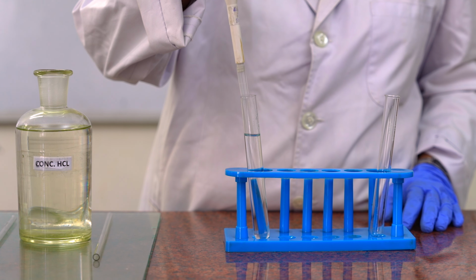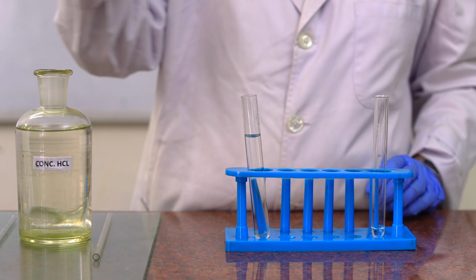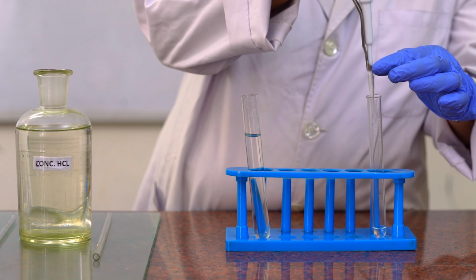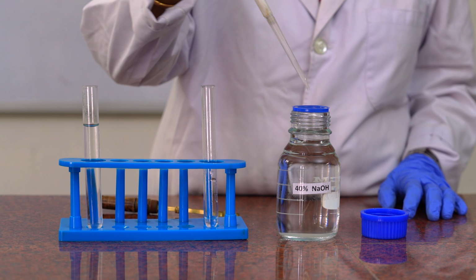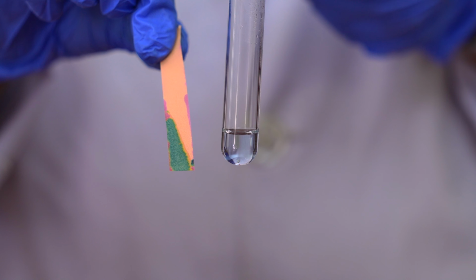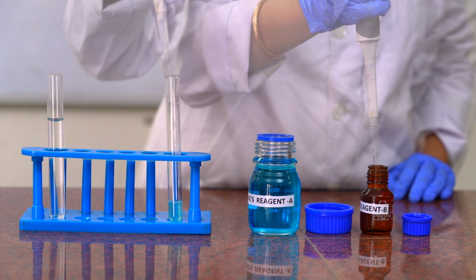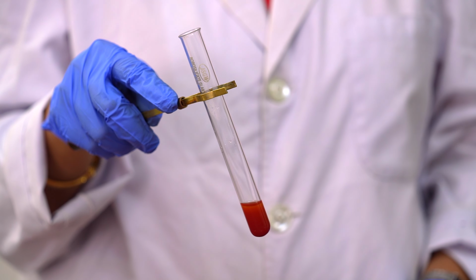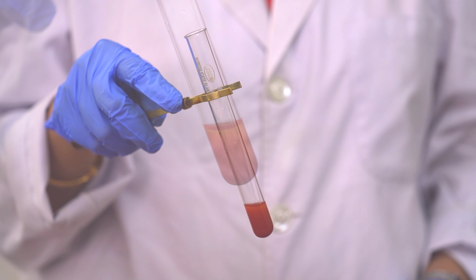So the common example is sucrose and starch. For this, we will take 1 ml of test solution and add few drops of concentrated HCl, and we will boil the mixture for few minutes and we will cool it down. Next, we will neutralize it by adding sodium hydroxide, and we can check it by litmus paper. Then the solution will be tested with Fehling's reagent, and we will get rusty brown or red precipitate, which will indicate the presence of reducing sugar in it.